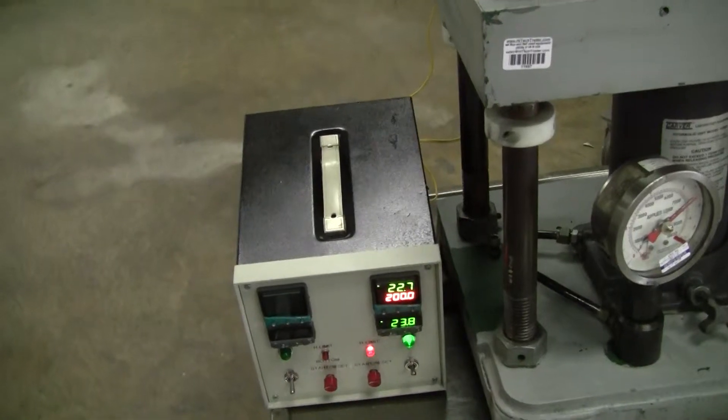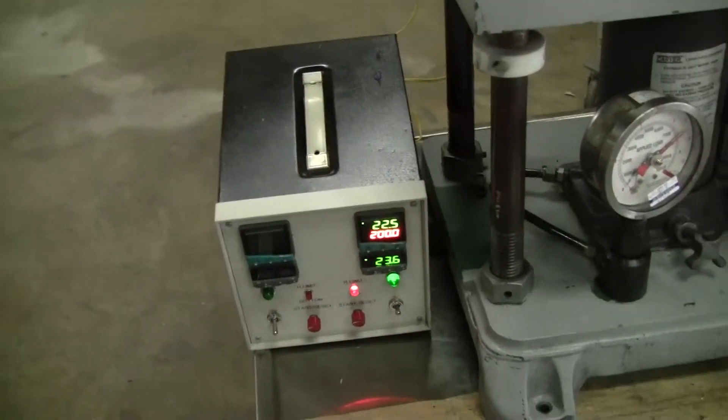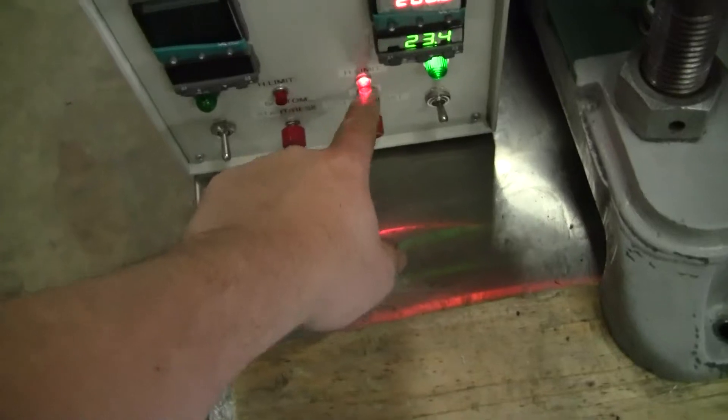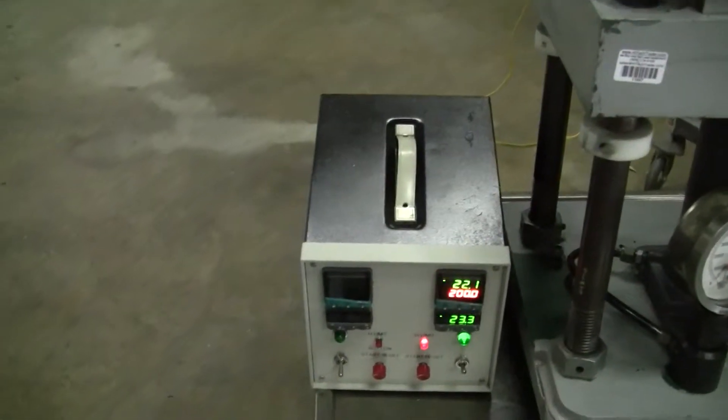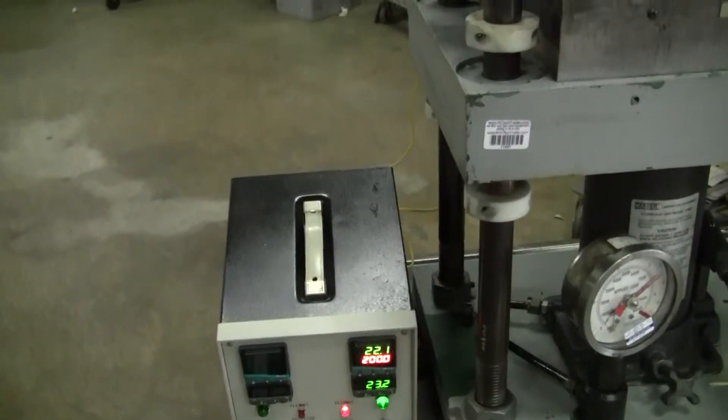Now, it's calling for heat, but it is not heating because of this over high limit button. That has to be turned off for it to throw energy to the platens.